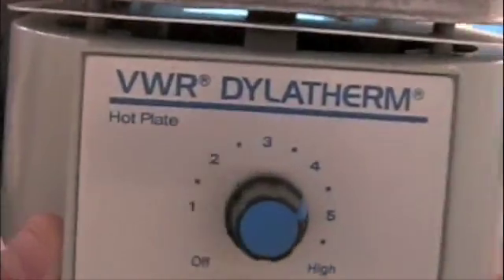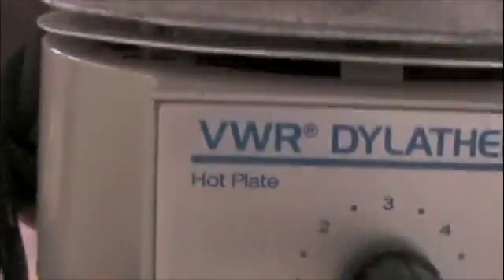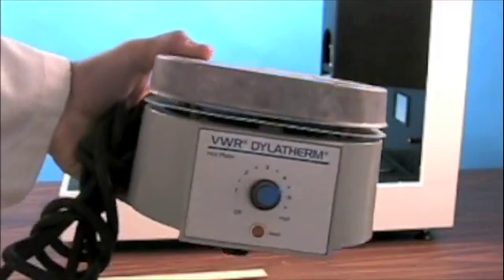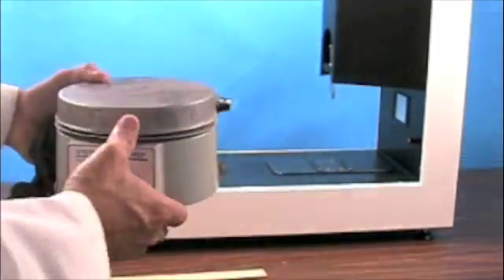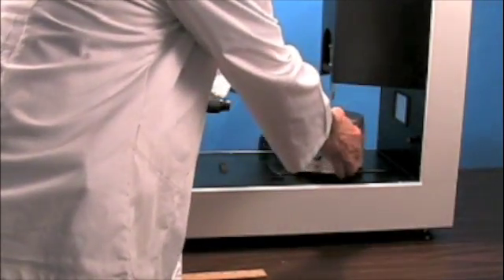Now this is an old VWR hot plate that we picked up. It's not the largest hot plate, but it's in here on the platform.